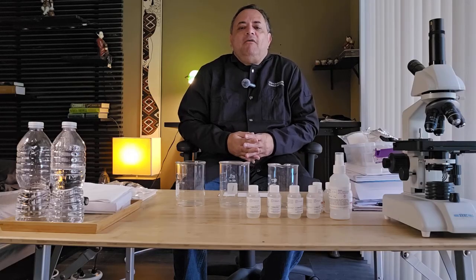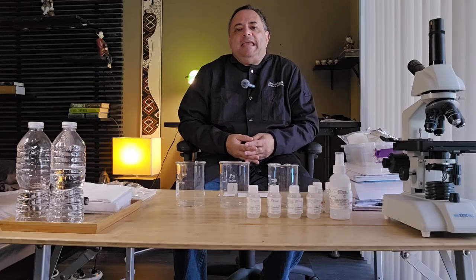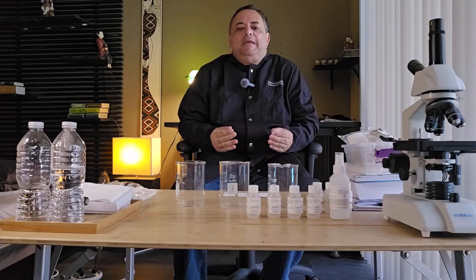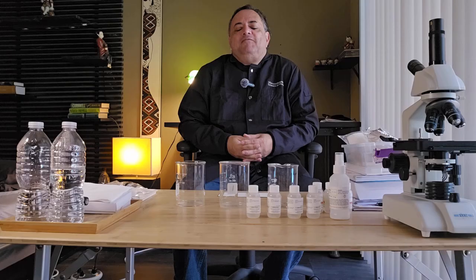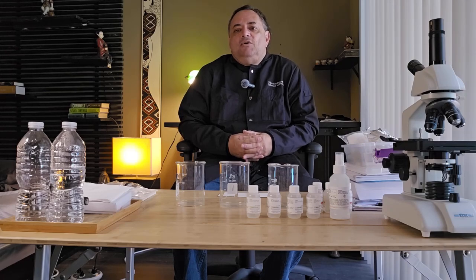In this lab, we're going to use ninhydrin. We'll discuss the ninhydrin reaction a little bit later when we come to spray the plates. So we spray the plates with ninhydrin in order to visualize the separated amino acids. Using the retention factor, we can compare our sample against the known standards to identify the amino acid in our unknown sample.